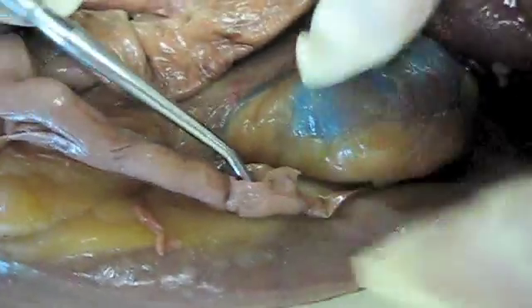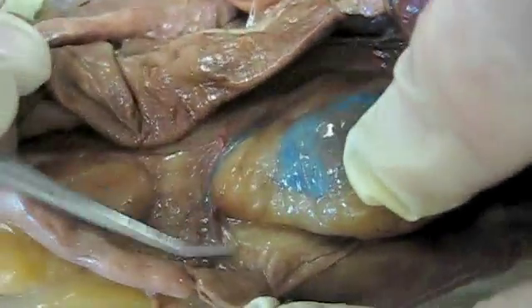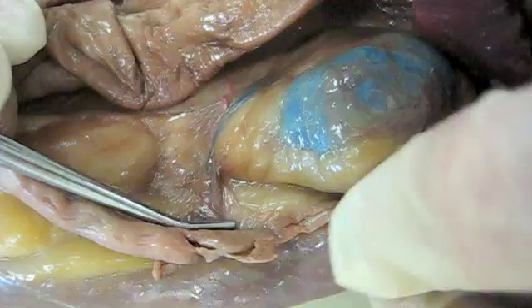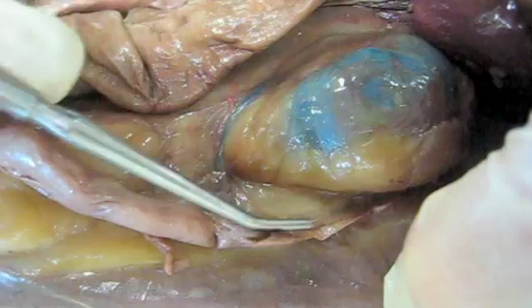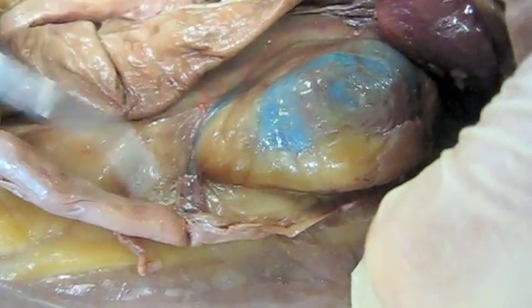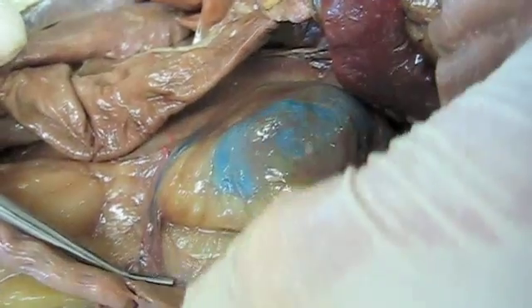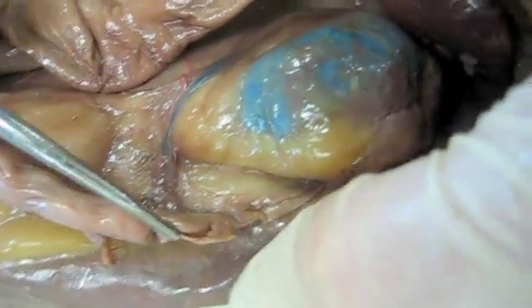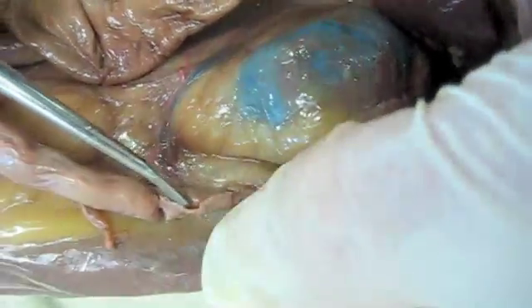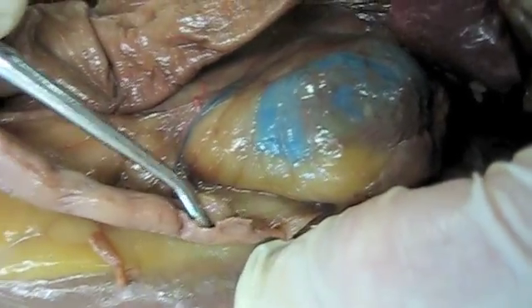Student: So the mesovarium is what? Instructor: The mesovarium is right here, directly supporting the ovary, as opposed to the suspensory ligament, which is this membrane that goes forward towards the kidneys. Student: So the mesovarium is smaller? Instructor: Yeah, it's just directly underneath the ovary right here. And the mesosalpinx would be this membrane in here that's supporting the oviduct.